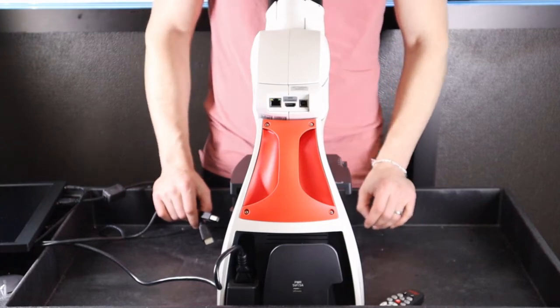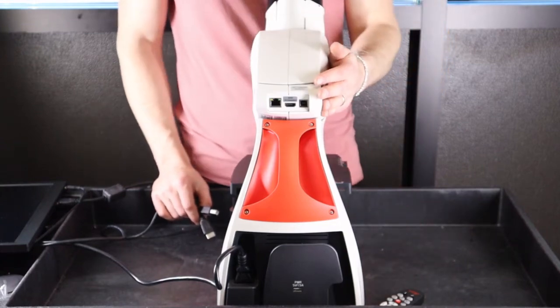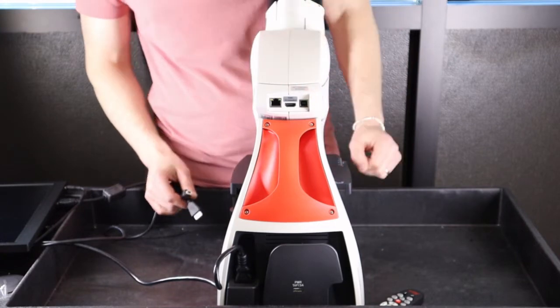This video demonstrates how to set up and use the ICC50W camera in HDMI mode.